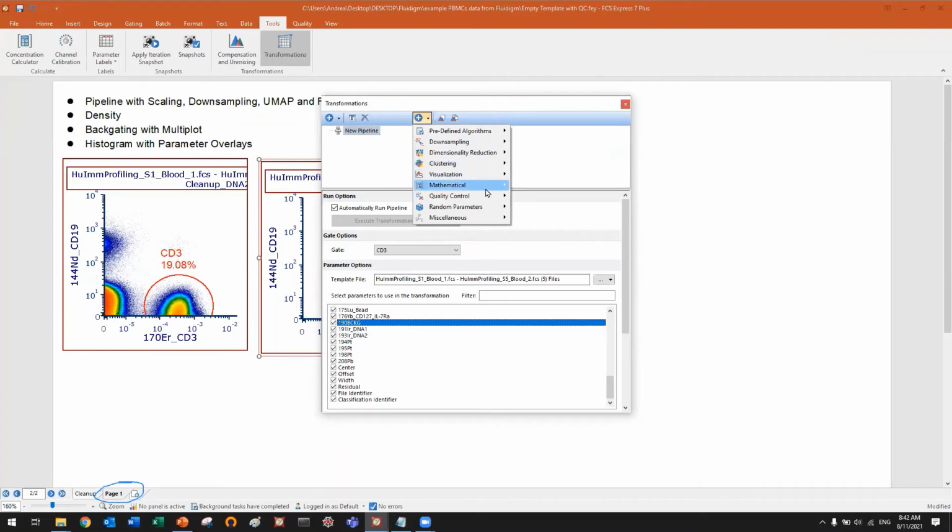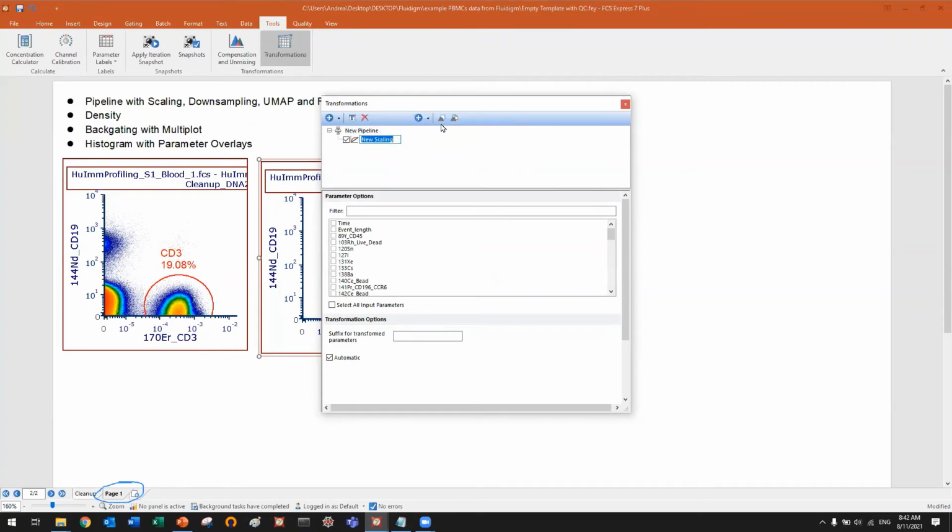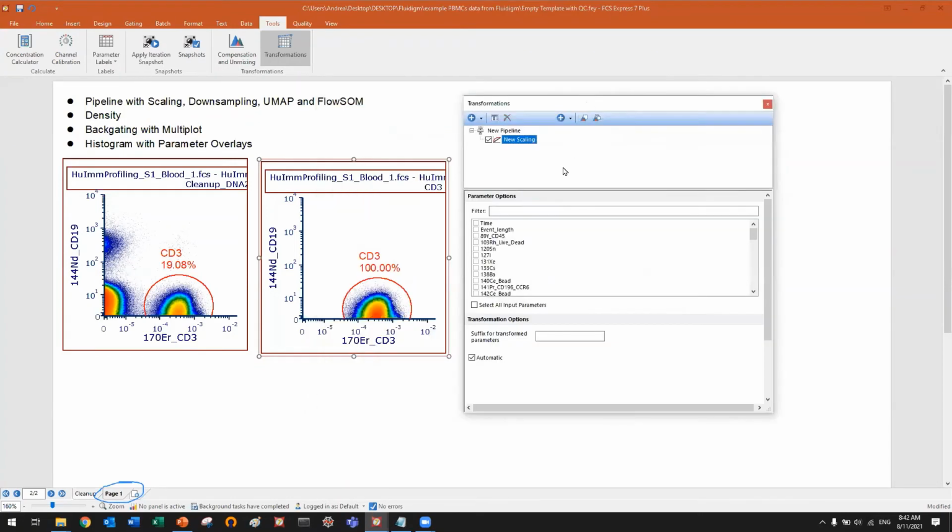I want to start with a mathematical scaling step. This is how we want to scale parameters. In this case, I'm going straight to, for example, select all the CD markers, taking for granted that we want to use all of them, but of course it's up to you. This is one of those steps in which you can select what you want. Let's see if we are missing something like TCR gamma delta, HLA-DR, IgD. So I probably selected all the markers included in this panel.